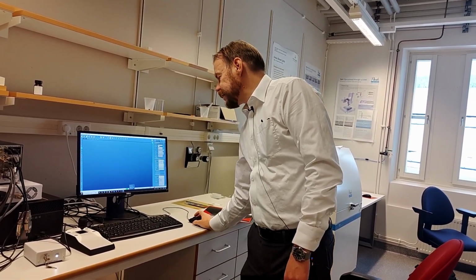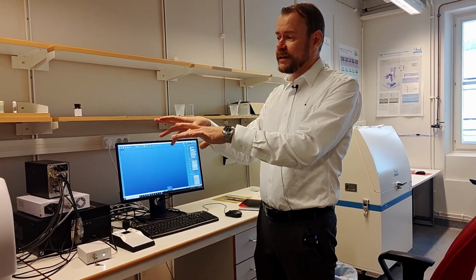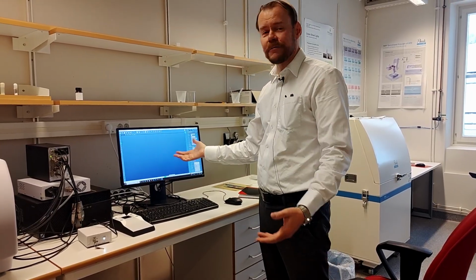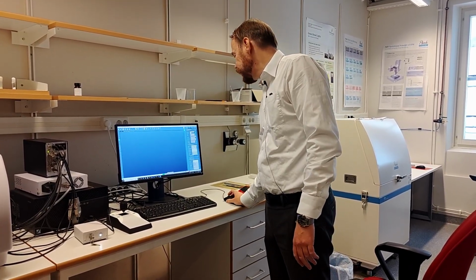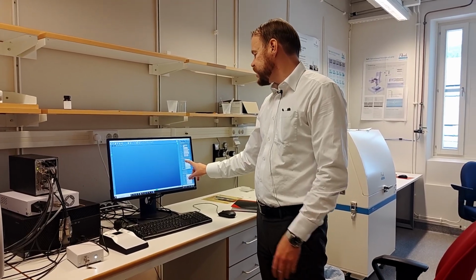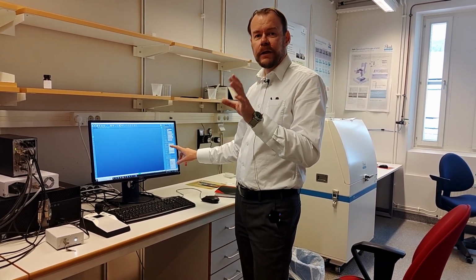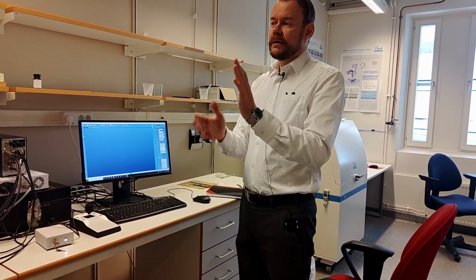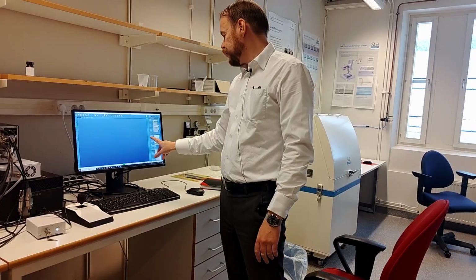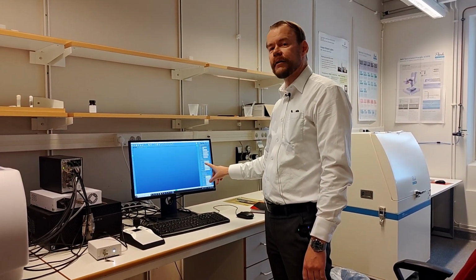So now it says 1800, so I think 1800 is fine. For this initial check, you can use whatever grating you like. It is on 1800, so we just leave it there for convenience. And then we can see that the center of the spectrometer at the moment is on 883 reciprocal centimeter, and the silicon peak is on 520. The range it covers now is 100 to 1500.